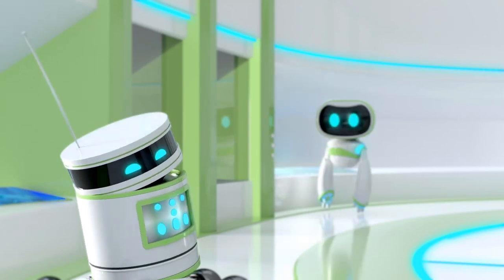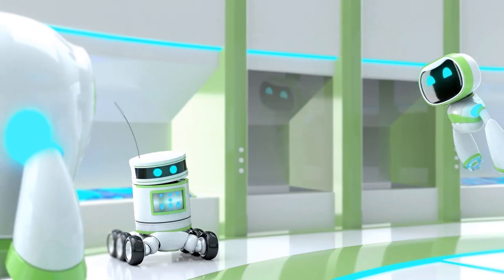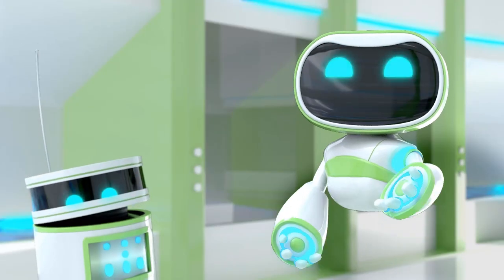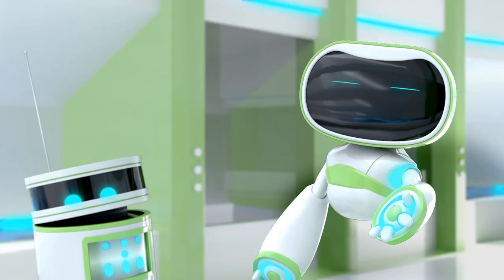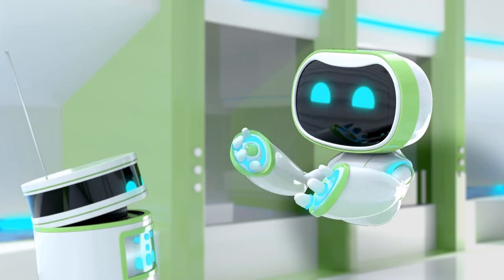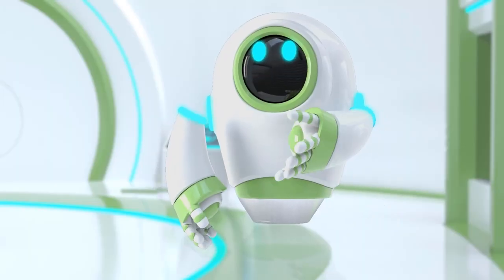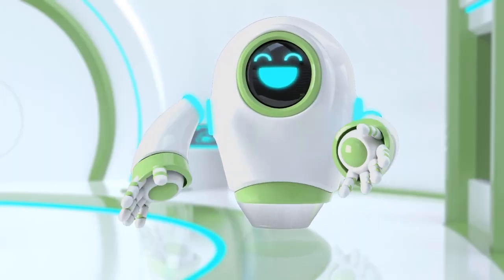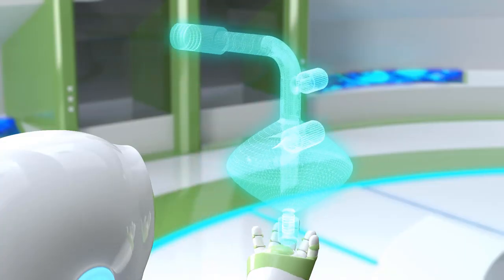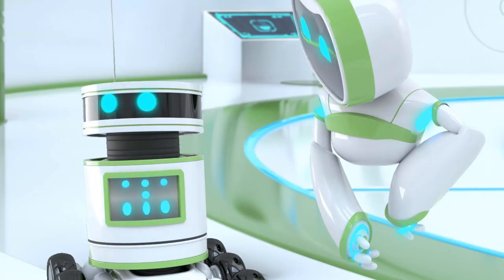AMS? What's that? AMS is Perkin Elmer's All Matrix Solution. It allows online gas dilution of your samples, both improving efficiency and preventing contamination. Correct — all Nexion instruments can use AMS. Here is a spray chamber with an AMS port.